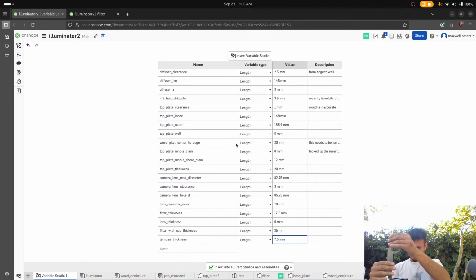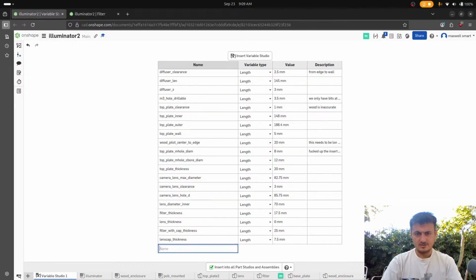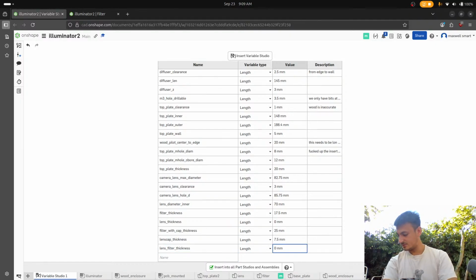I'm just stopping it. Like 106. We have better datum here. 105. Okay, it's not like the whole thing is absolutely critical, but let's say lens filter thickness. Bro, I'm being so dumb right now. What did I say? 105? Okay, 105. We're just gonna do that.